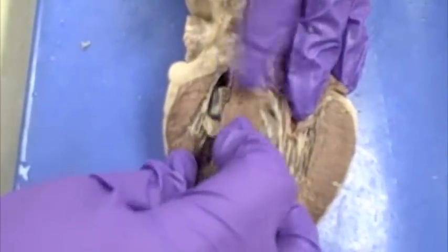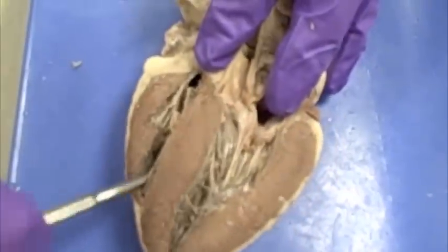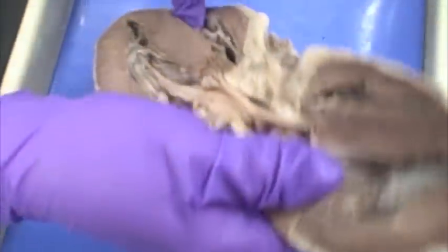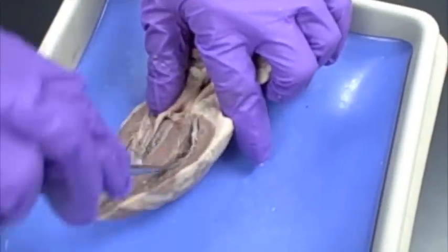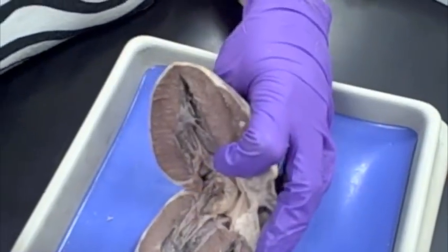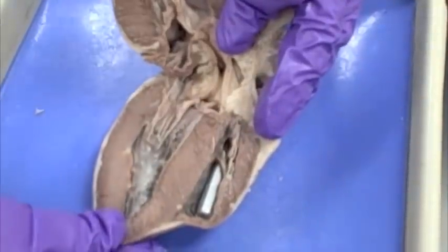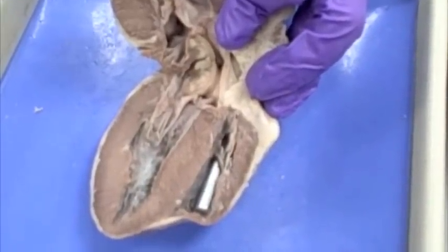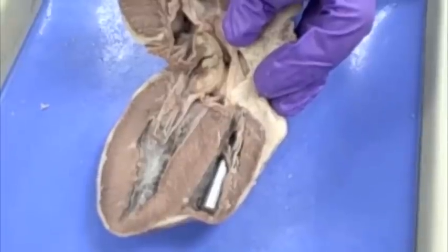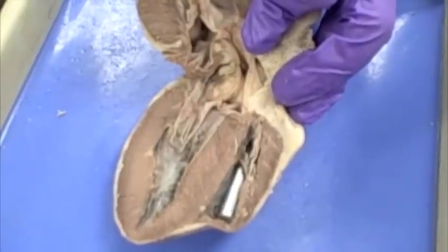You know it's going to be in the right atrium because the end of the probe is before it gets to the actual valve. For the pulmonary trunk — it's out this direction. You would be able to look at this and say this is the right side of the heart, and the probe is leaving the ventricle, so that's going to be the pulmonary trunk or the pulmonary artery. Those are the four blood vessels you need to know that are bringing blood towards the heart or taking blood away from the heart.